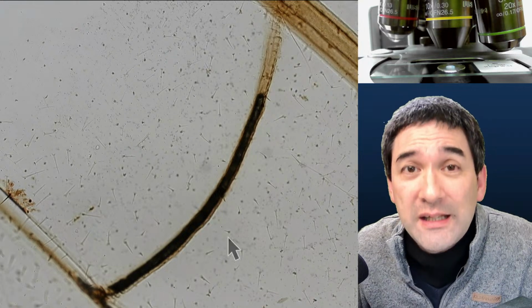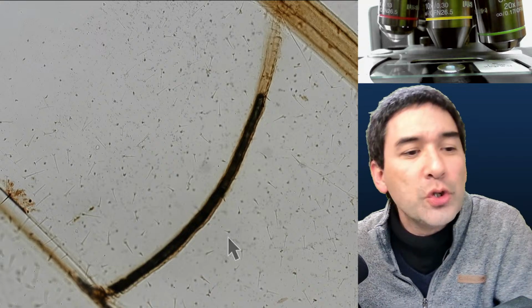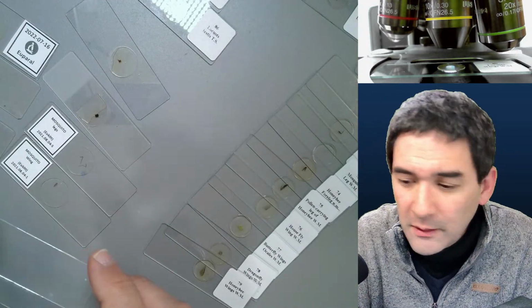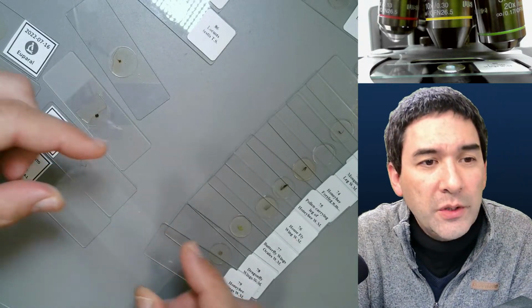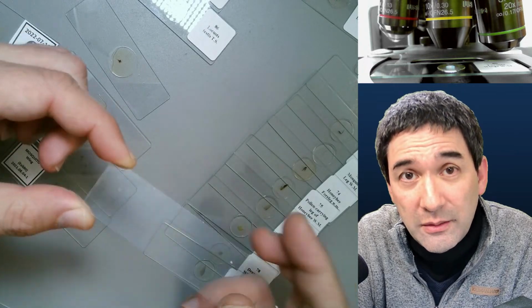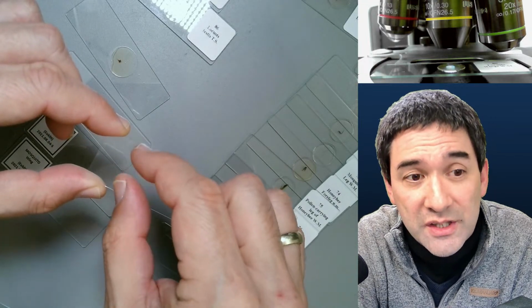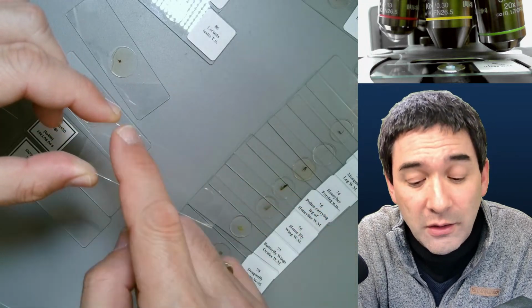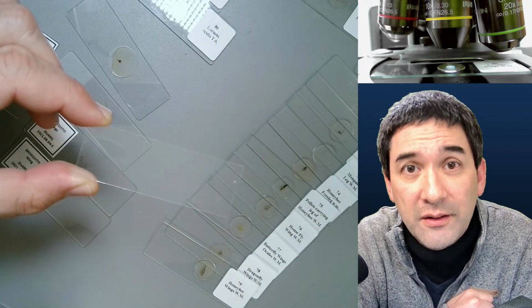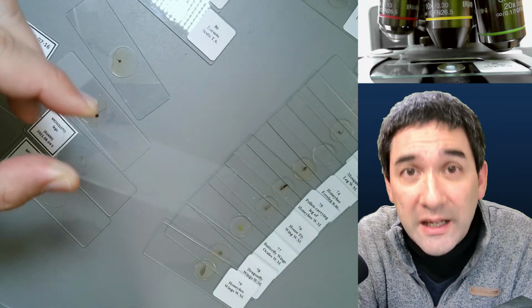My suggestion is that you put a cover glass. I'm going to switch over now to the desk. I know it's a little bit of an off-topic question, but it's fine. I don't have those with me right now, but if you've got a specimen here, like a crystal, and you want to protect it somehow, what I suggest is that you get yourself large cover glasses. There are actually large ones, and then you can try to tape them down on the side. Then basically it's a so-called dry mount, and then it's protected.